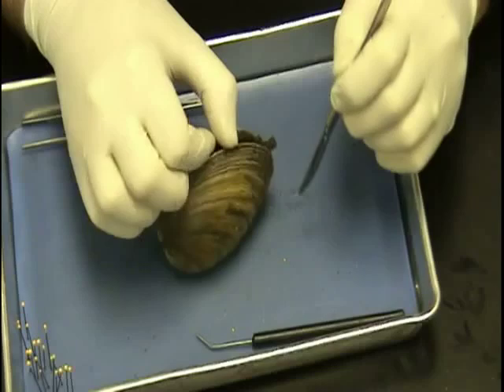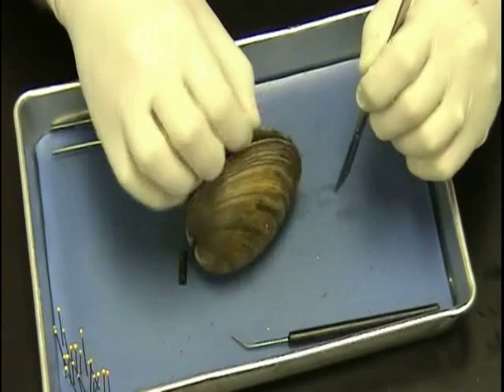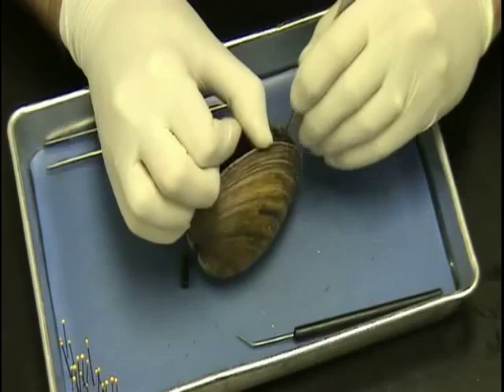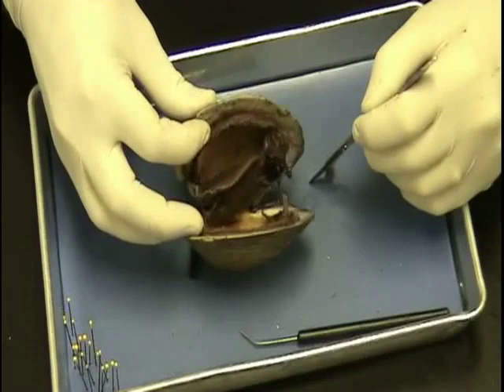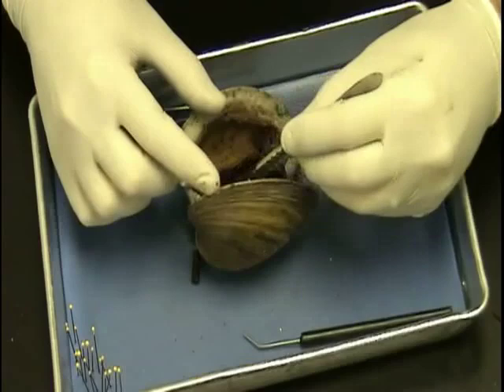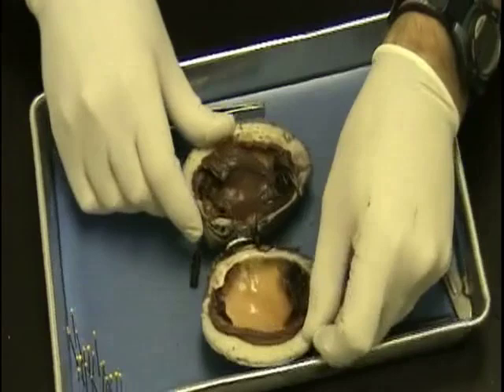Notice that I'm cutting straight down and away. Then I'm going to turn it and do the same thing on the other side — slip my scalpel down in there and cut. I put in a little bit of pressure on that valve, just a little bit. Always want to make sure that you're cutting down and away and your hands are on top. I'm going to gently pry that open. As I do, I'm going to look and see which side is coming off a little easier from the tissue from the valve. I'm going to cut that right there, let that lay open, put that down and away, and open that up.